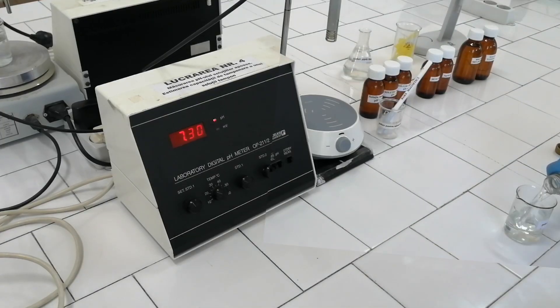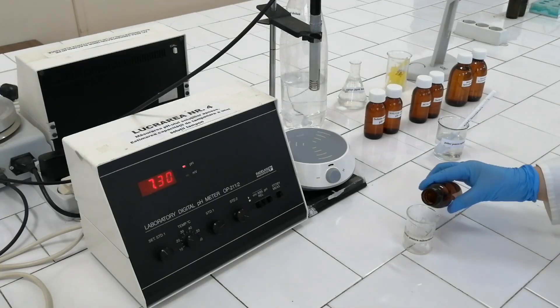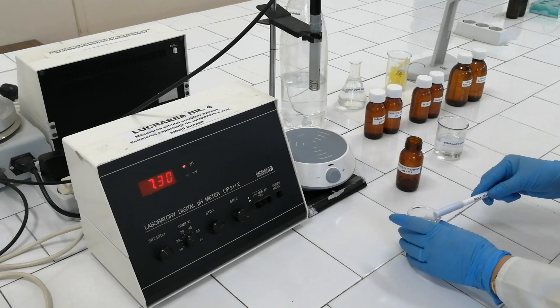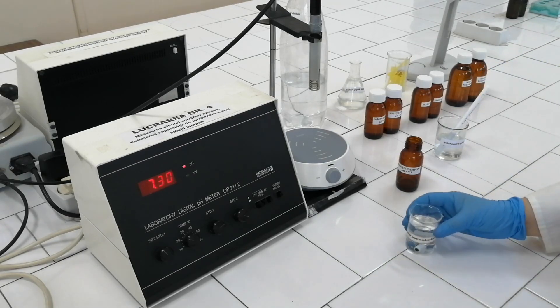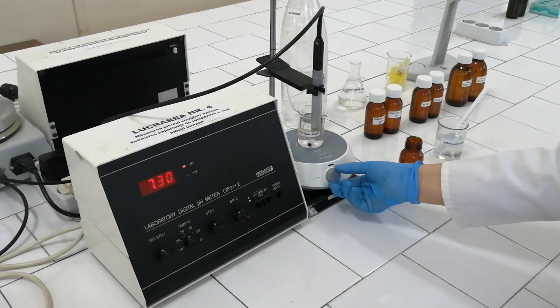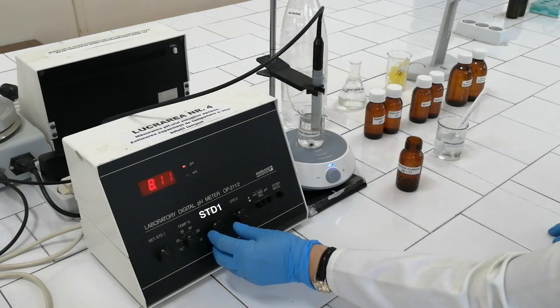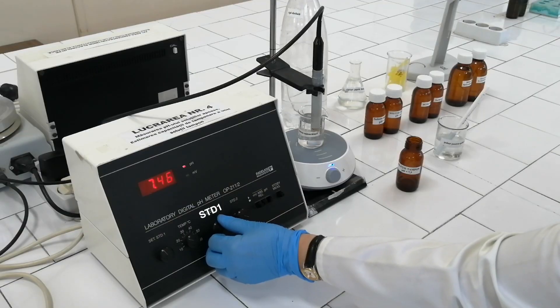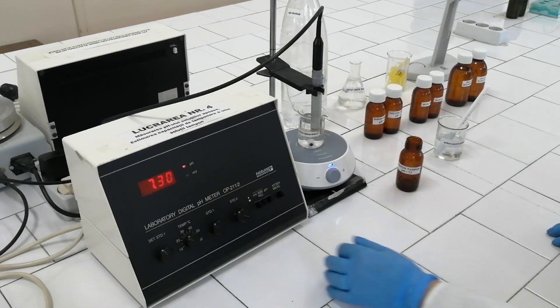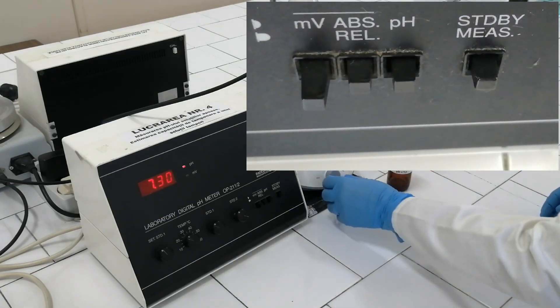After rinsing the electrode, the Berzelius glass and the magnet with distilled water, fill the glass with the standard solution of pH 7.3. Place the glass on the magnetic stirrer and dip the electrode into the solution. Set the measurement working mode and rotate the button STD1 until the value 7.3 is obtained on display. Set the pH meter in standby mode and lift the measuring electrode.